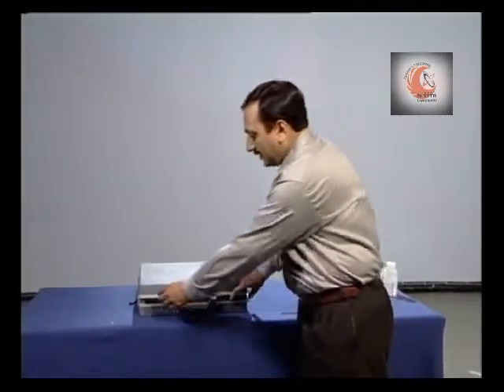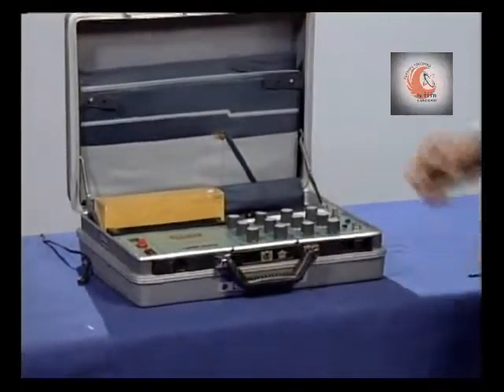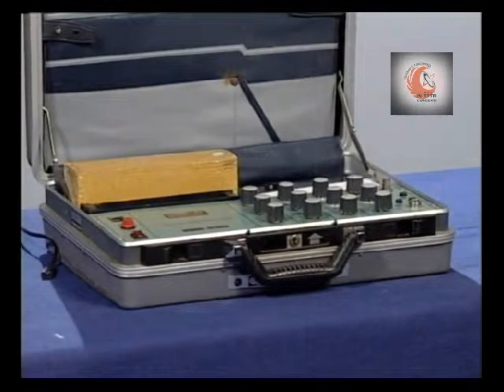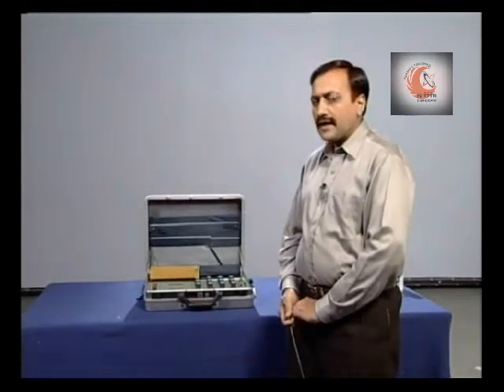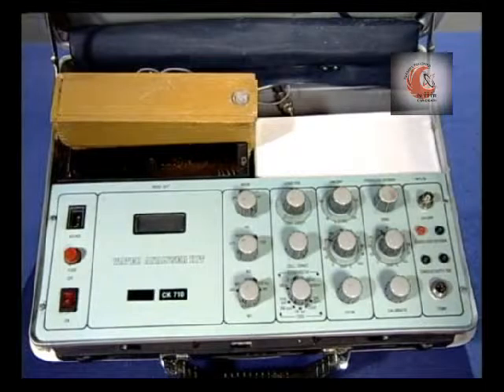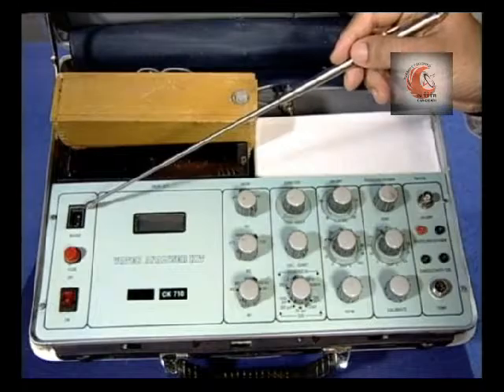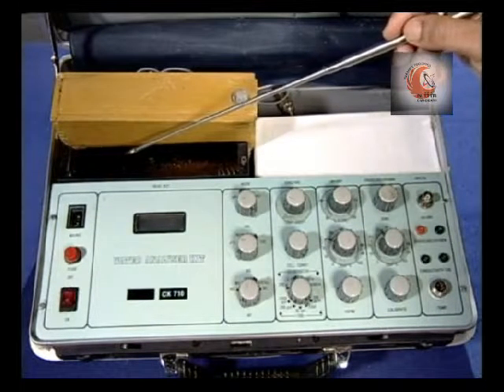A water analysis kit is a simple instrument which can be used to simultaneously measure various impurities like pH value, conductivity, total dissolved solids and temperature, etc. The instrument comprises various controls. The instrument can be operated using an electric supply, or a battery supply in case it is used in the field.